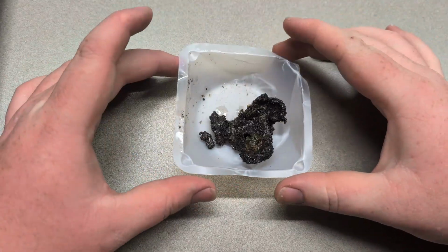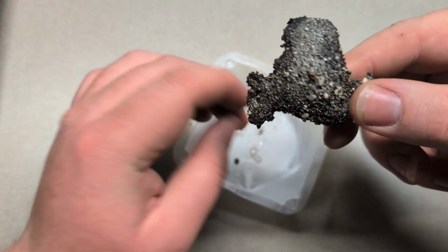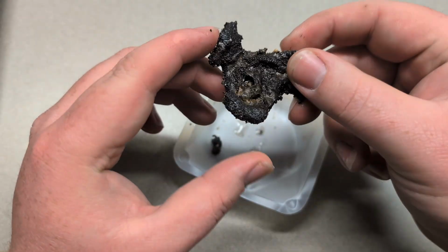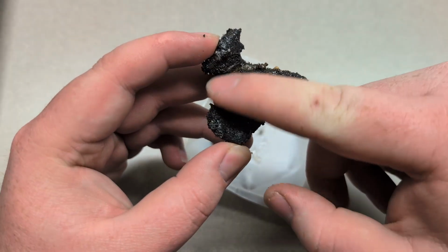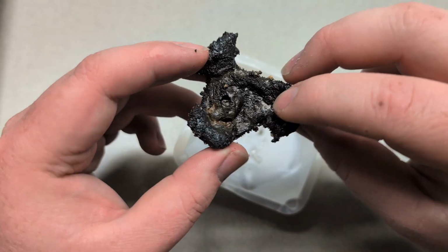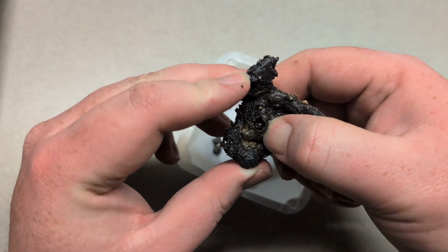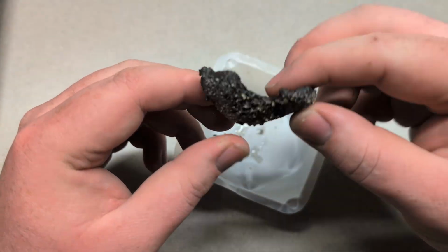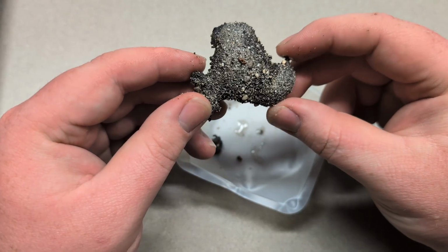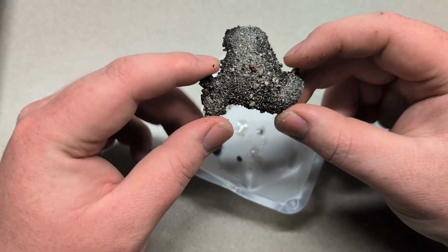Here's the slag from the reaction. It has a little bit of sand on the bottom from the sand inside the can. But a lot of this is actually aluminum oxide slag that has solidified on the top. Inside there, if we could break it all open and get it out, is a little bit of iron right here that's settled at the bottom. The iron is a lot denser than the aluminum oxide when it's a liquid.